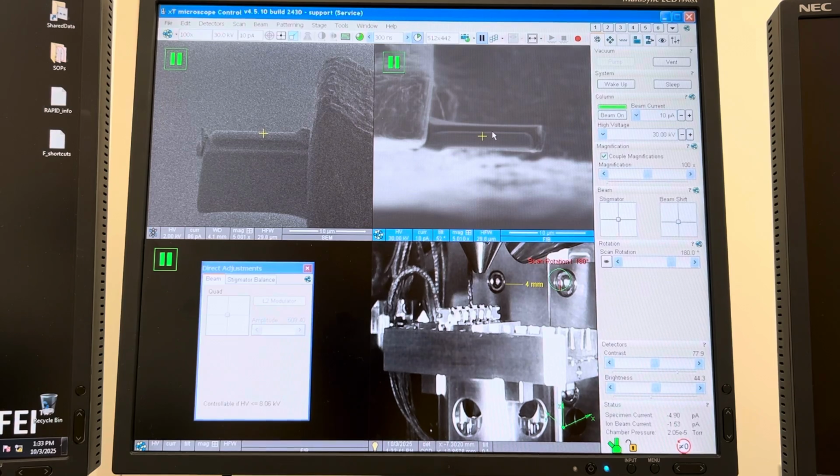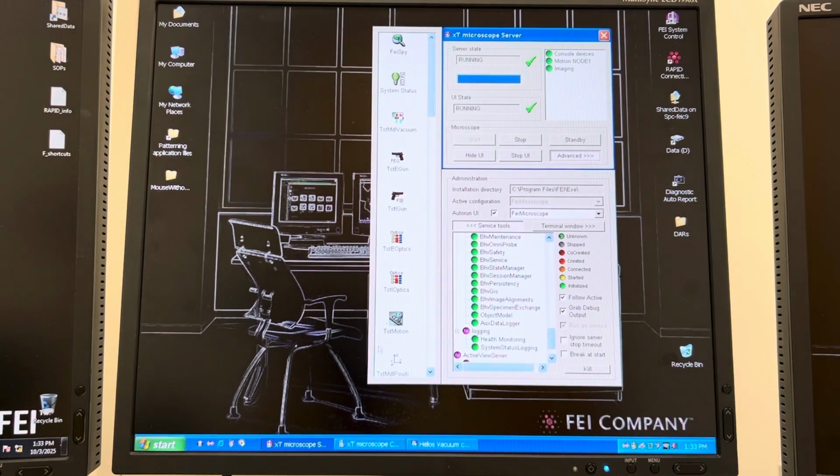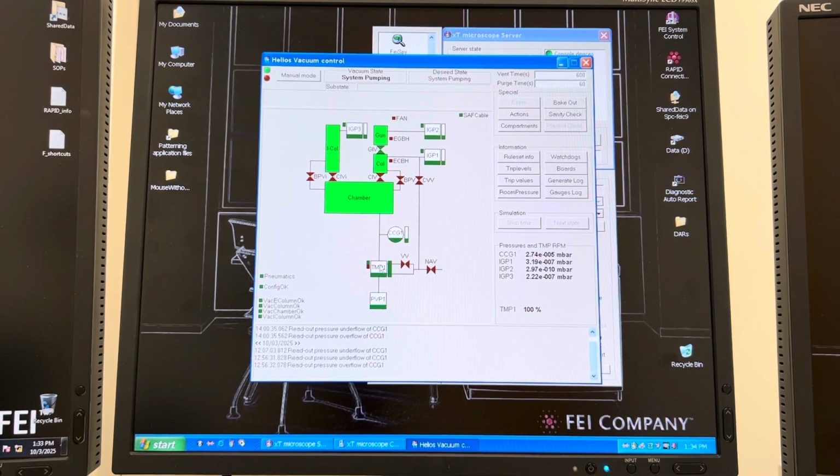So if you don't want to wait, one of the things you can do to help hurry this along is to repeatedly vent and pump the chamber. This is like a purging, if you will. Basically, every time we vent, it's shutting off the pumps, and then it's opening the vent valve and the valve for the nitrogen. Then it's purging this entire line here and into the chamber with dry nitrogen, which, in our case, is UHP nitrogen, has no water vapor in it or air or anything. It's very clean, and that will help to get the water vapor out of the system. If you do those purges, you might have to do a few of them, you might have to do many of these in order to expedite things.